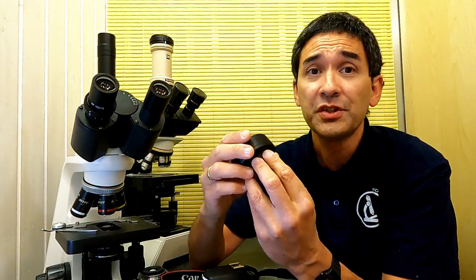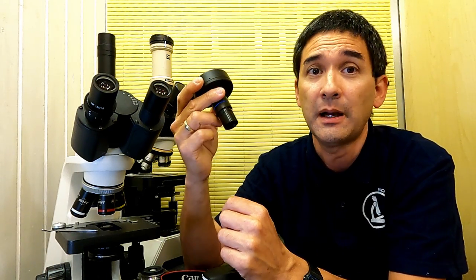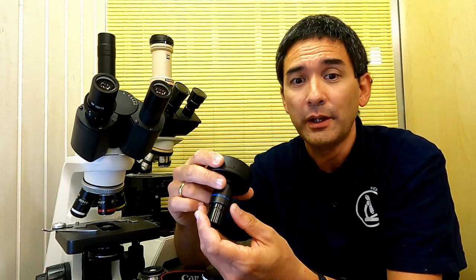You might even wonder, essentially, okay, if there are no decent or not so many decent DSLR adapters out there, why do they even make microscopes with a photo tube? Well, I want to show you here. This is because there are, of course, many of these so-called eyepiece cameras out there that can be directly plugged in. Yeah, and then over USB, you can connect them to a computer, and then you can, of course, do video and take pictures directly over the computer.